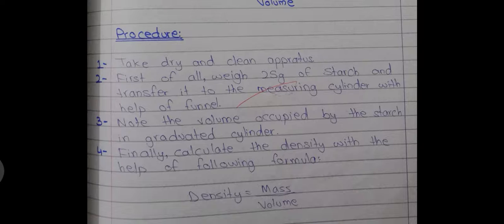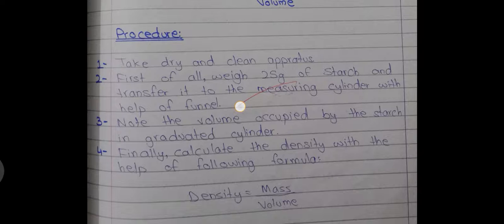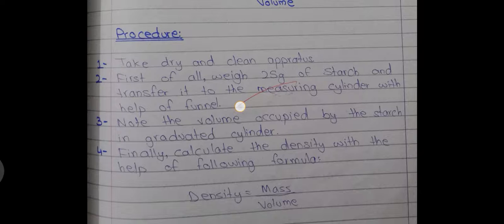We put those values into the formula: density equals mass over volume. From our calculations, the mass of the given sample is 25 grams, and when I put the 25 grams of starch into the graduated cylinder the volume came out to be 50 ml. So the density of the starch is 25 over 50, which gives 0.5 grams per milliliter.